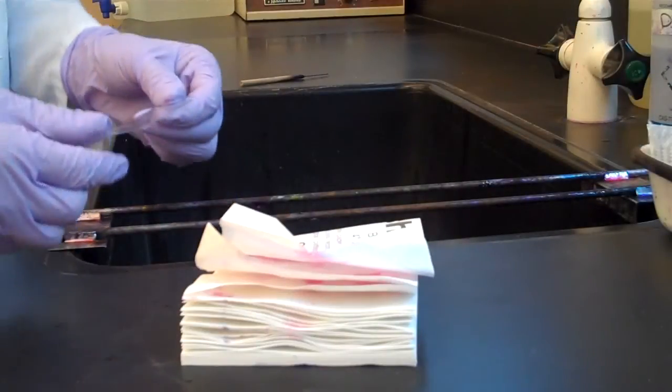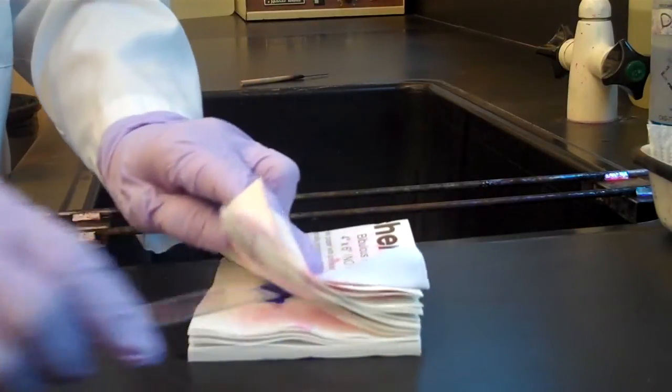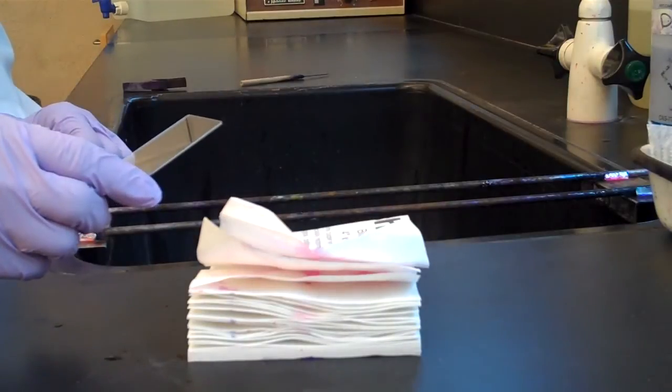Blot your slide and now it's ready to be viewed underneath the microscope.